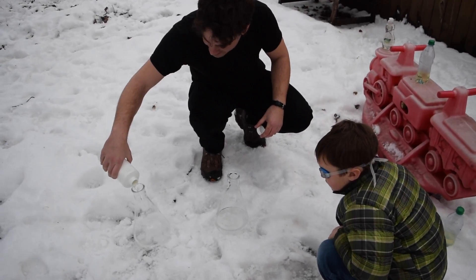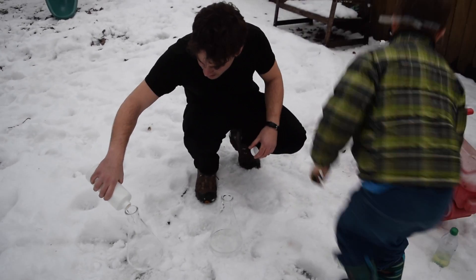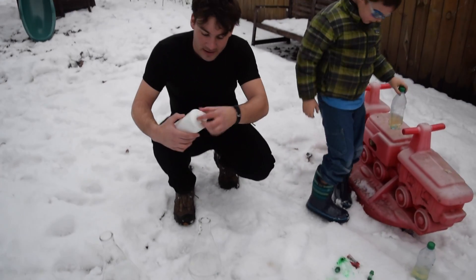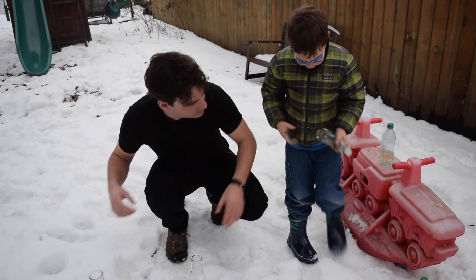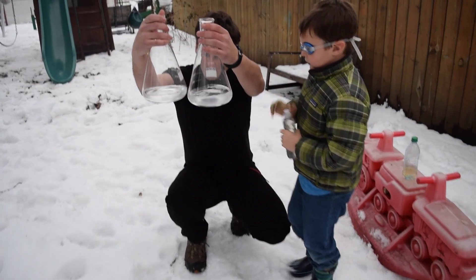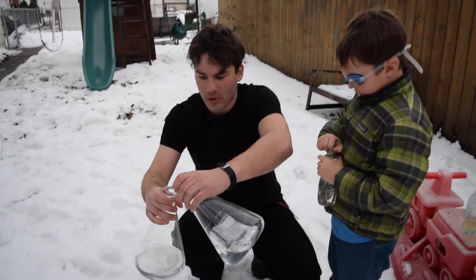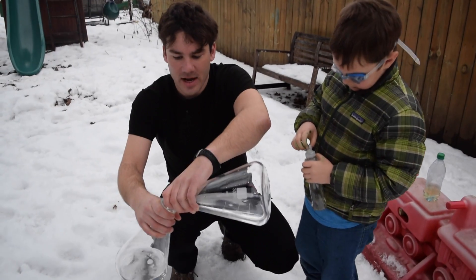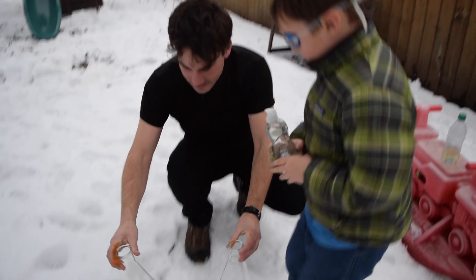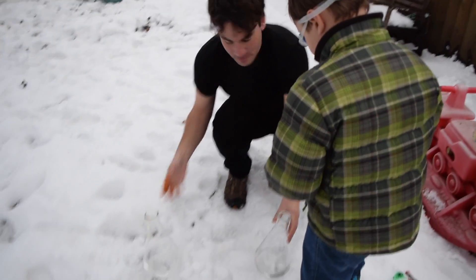I don't want to spill. You can do the next one. Oh, that's going to be third. We're going to do a couple things. So we've got hydrogen peroxide in here. It's about equal — maybe I'll pour a little bit more in there. So that's maybe 400 milliliters. And now we're going to pour some dish soap in.